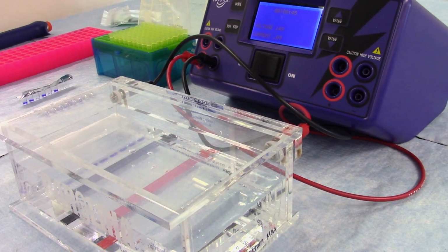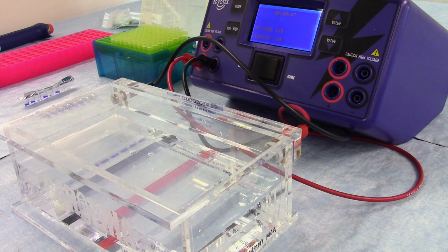Again, our current is being split into positive and negative charges. The negative charge is coming through the black wire at the top of the gel where our samples are, and the positive charge is coming to the far end of the gel through our red wire. The reason why the charges are split in this way is because the DNA samples are negatively charged and we want them to move down the gel. So giving the far end a positive charge draws the samples to that side.